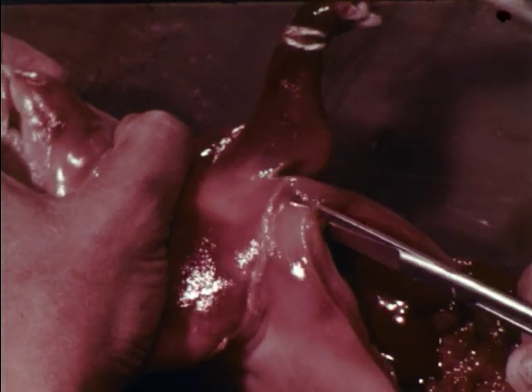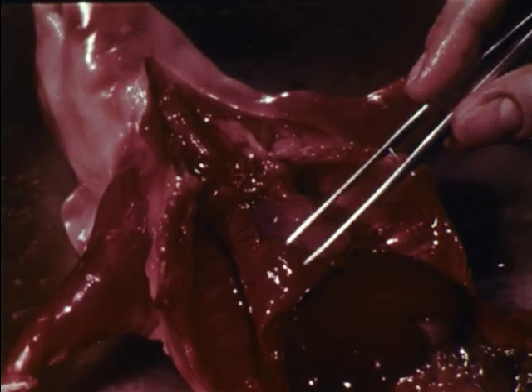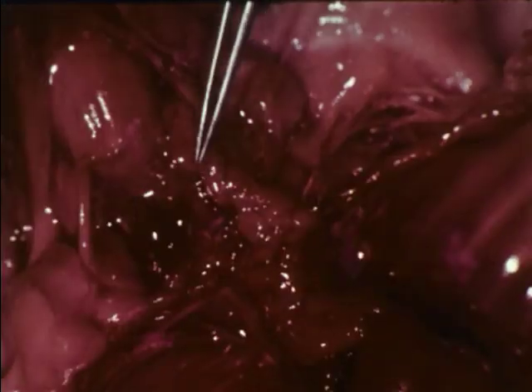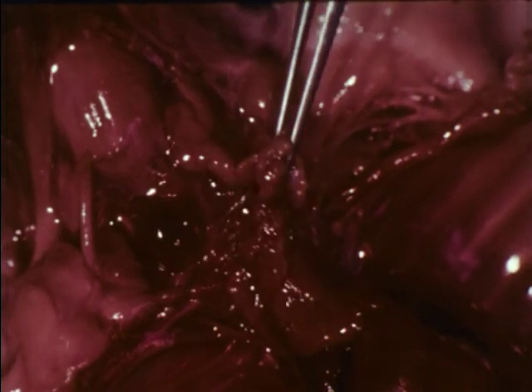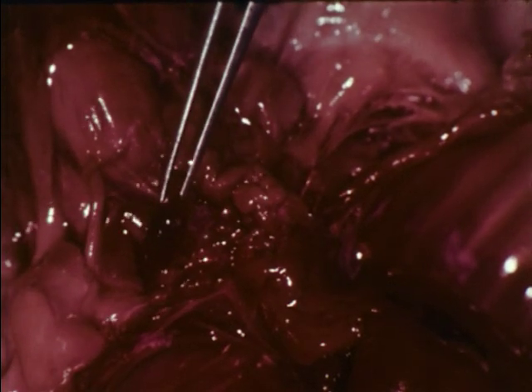Next, the organs in the neck and thoracic cavity will be examined. The most obvious organs in the thoracic cavity are the heart and the two lungs. The thymus gland is also prominent. It extends from the neck into the thoracic cavity. This is the thyroid gland, which plays an important part in the control of metabolism.